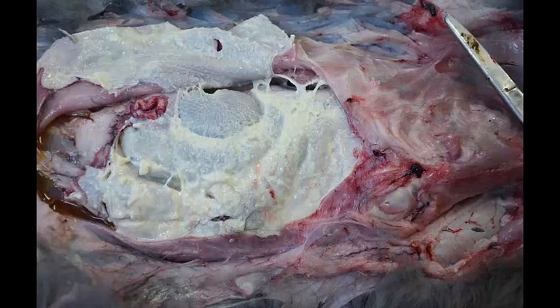This is just absolutely a classic disease of rabbits. The head of the rabbit is going to the right. Here's the unopened rib cage, but the abdomen has been opened. This is a diffuse severe fibrinosuppurative peritonitis, and the cause is Pasteurella multocida, the bad actor in rabbit medicine.